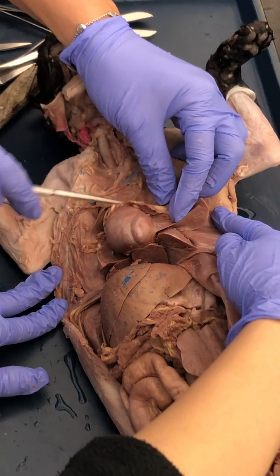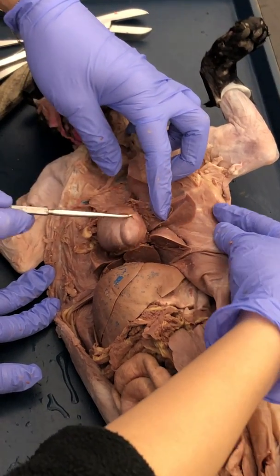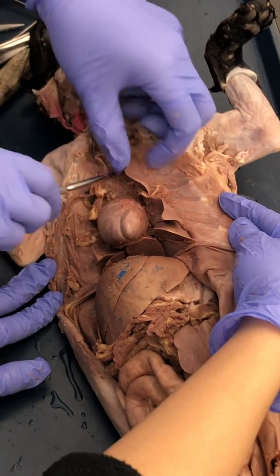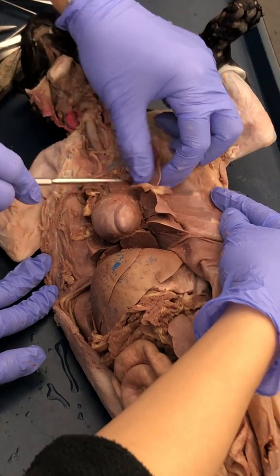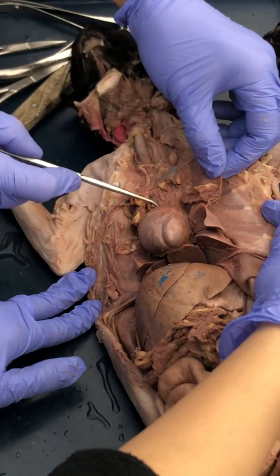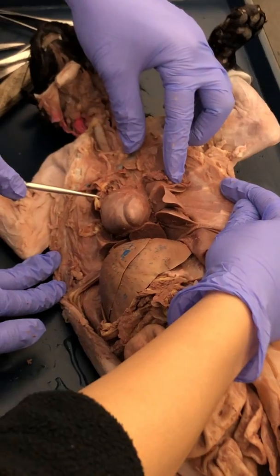If we clear away the adipose, you can see that there is a little layer. This is the pericardial sac, right above the heart, in this region right here. We have to clear some of this connective tissue away. Actually, it looks like it might have already been cut away. Right up here, usually covering the veins, is the thymus gland. I don't see the thymus gland here, but it's very soft, and so it disintegrates. So the thymus gland would be right here.